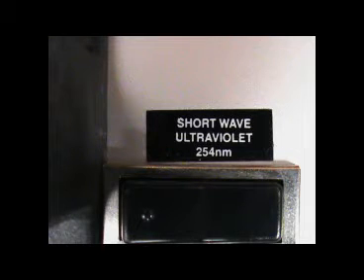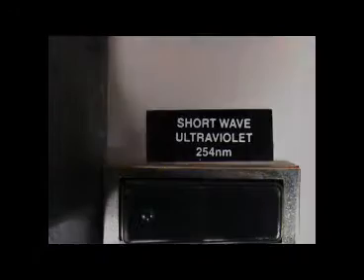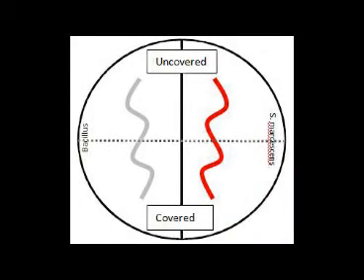Shown here is a UV light box. This light box uses a wavelength of 254 nanometers. The most effective germicidal lamps will have a wavelength between 200 and 290 nanometers. This is a diagram depicting how your plates should be inoculated. After inoculation, you will be exposing the plates to the UV light. Half of the plate should be covered with an index card and half of the plate should not. Remember, out of the 4 plates, only 3 are being exposed to UV light. One of the plates will be a control. There will be no exposure to UV light for the control.